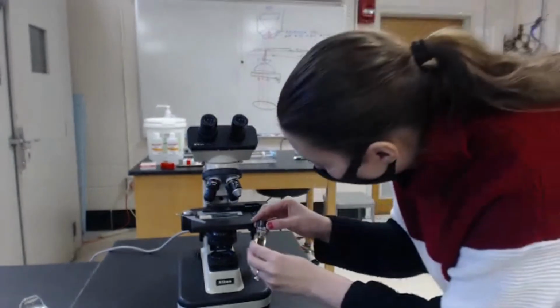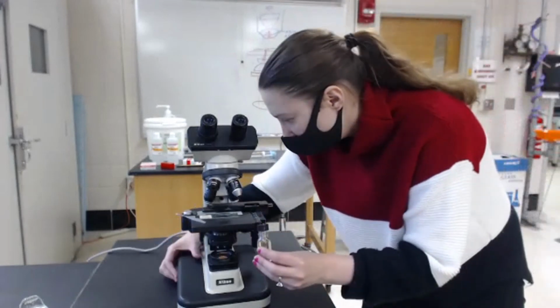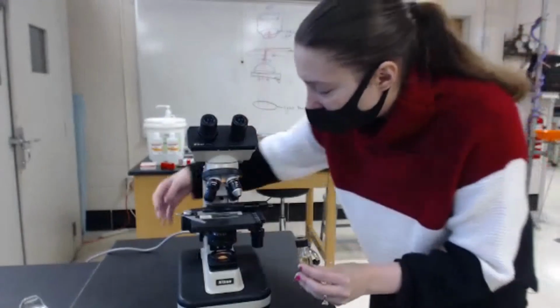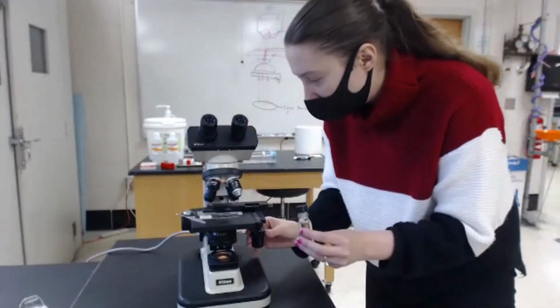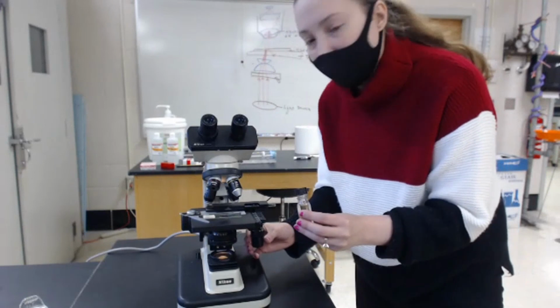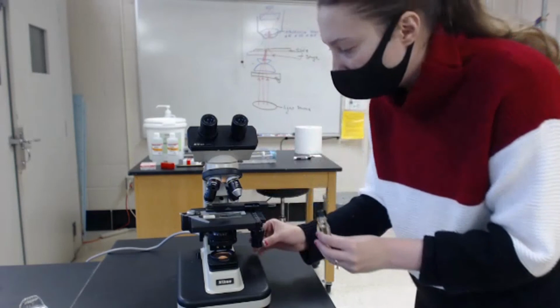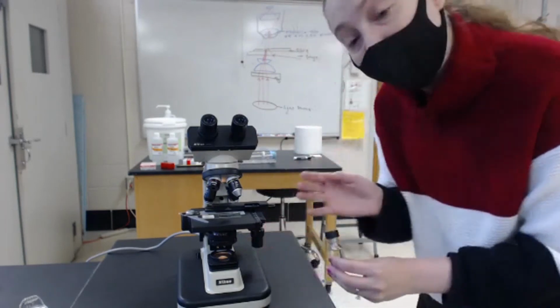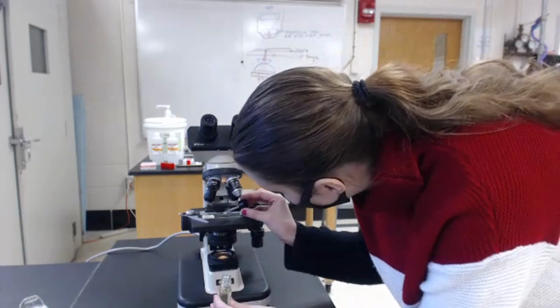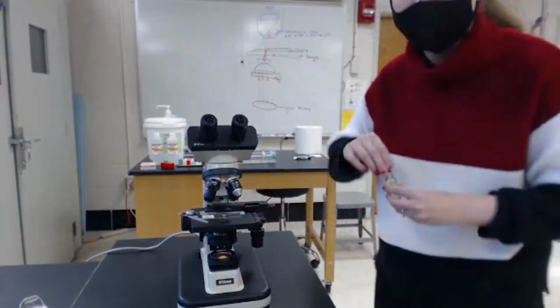So when we are working with our oil, what I like to do is, with my naked eye, find where the sample is, just using the light to shine through it and view that structure. And once I find the general location where it would be found, I take a drop of oil and place it on top of that area.